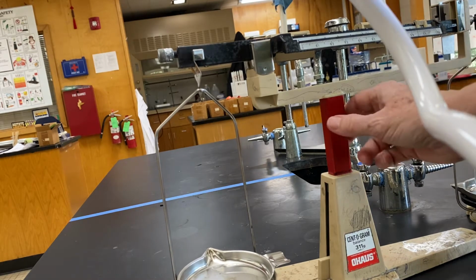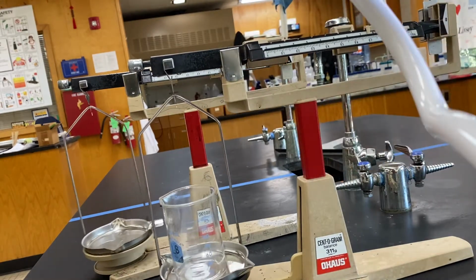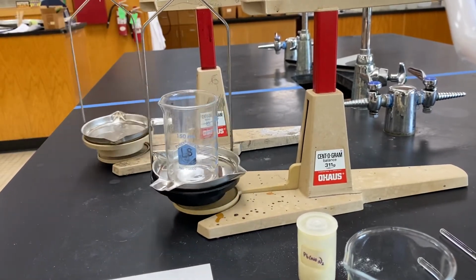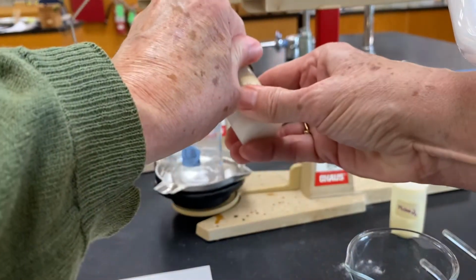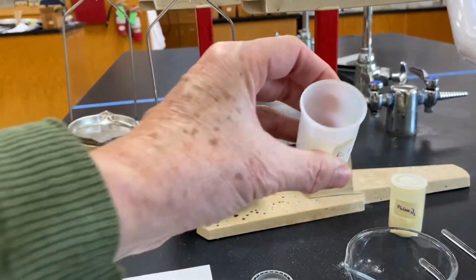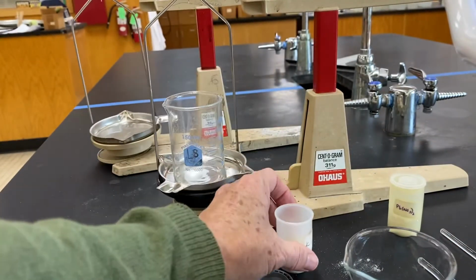Then I have another scale set up here with the second beaker, and it happens to be preset already. This is going to be beaker number 8, and its mass is 68.95 grams, 68.95. And in this beaker, I'm going to put my potassium iodide. Potassium iodide actually looks similar. It's a little more crystally and less powdery than the lead 2 nitrate.